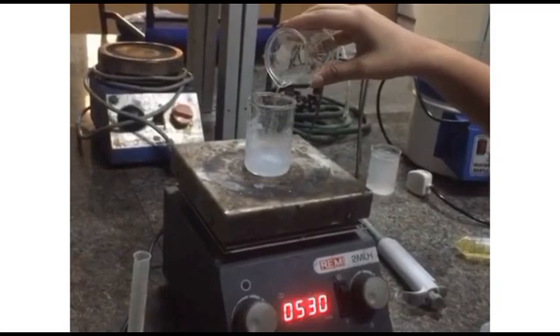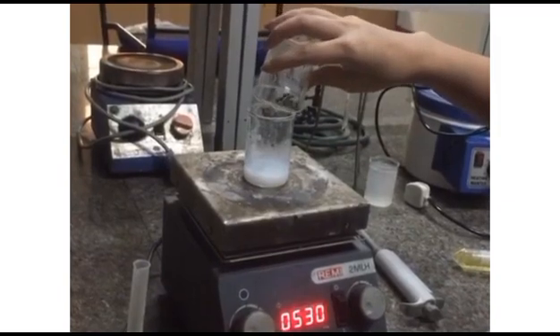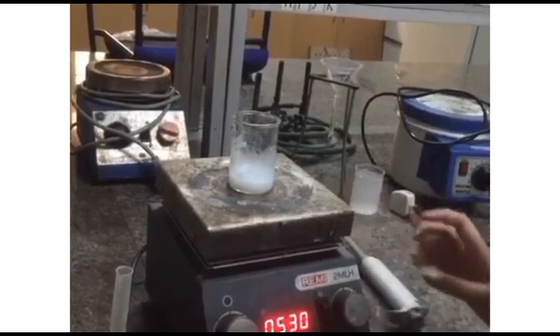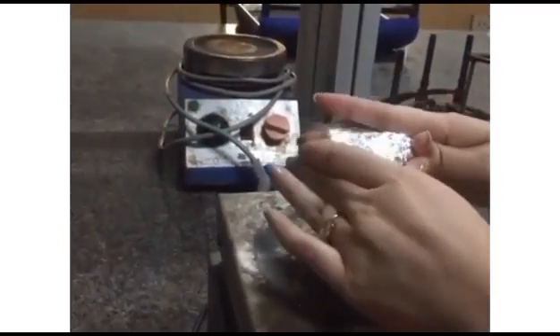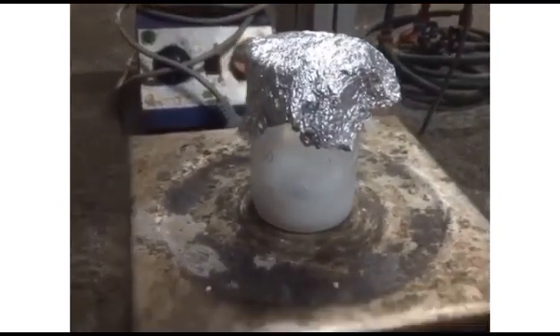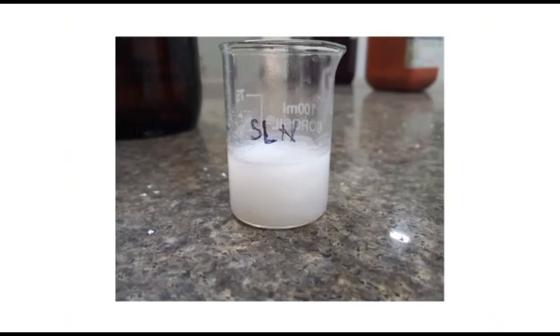After the solid lipid was melted, the aqueous phase was mixed with the organic phase and stirred again on the magnetic stirrer at 500 to 550 rpm at 70 degrees Celsius until the SLN was formulated. It was covered to avoid evaporation, and after that the final formulation was obtained.